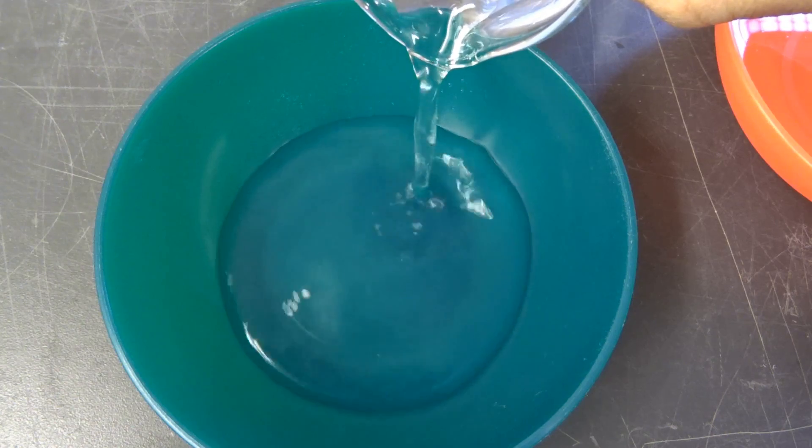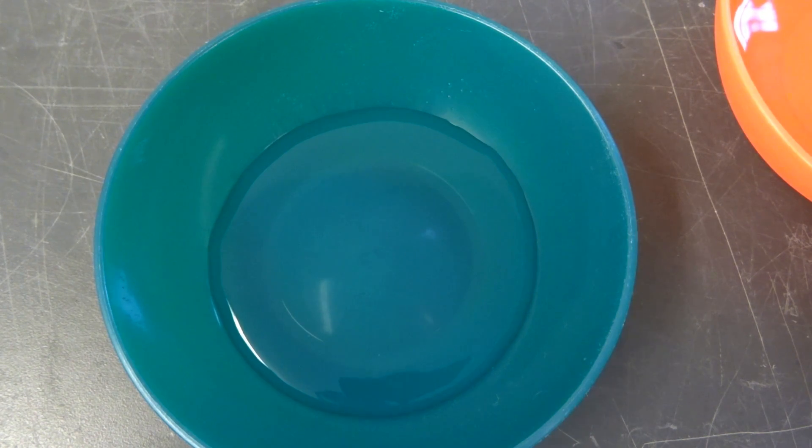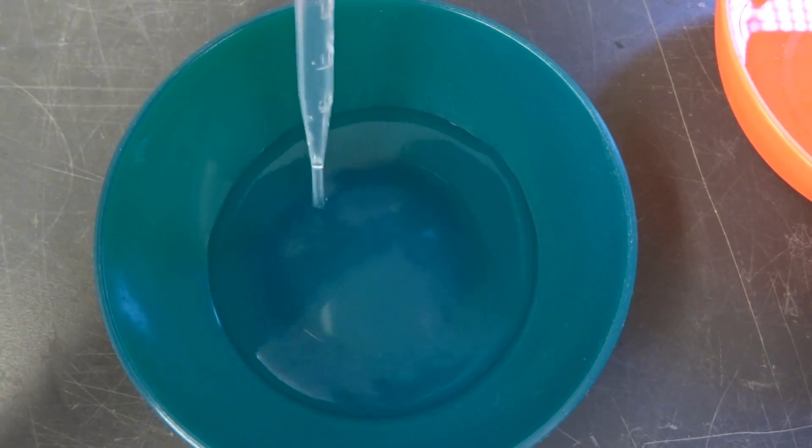And I really like the appearance of them, and they had a good thickness, maybe I make them a bit thicker. And that's what I'm trying to make, just out of interest. In these gels, maybe I use them as insulation, I play with their properties, what they can do. We'll see in the future if I manage to dry them.